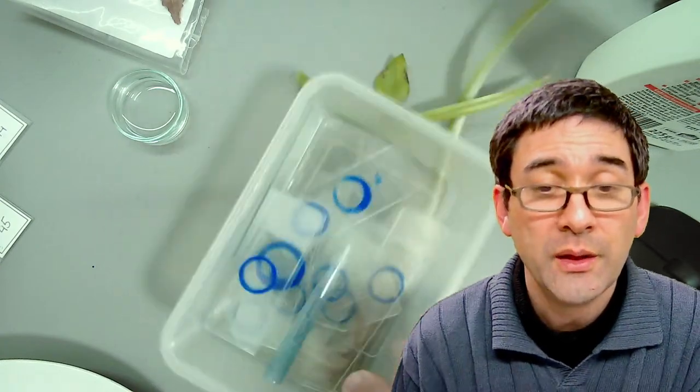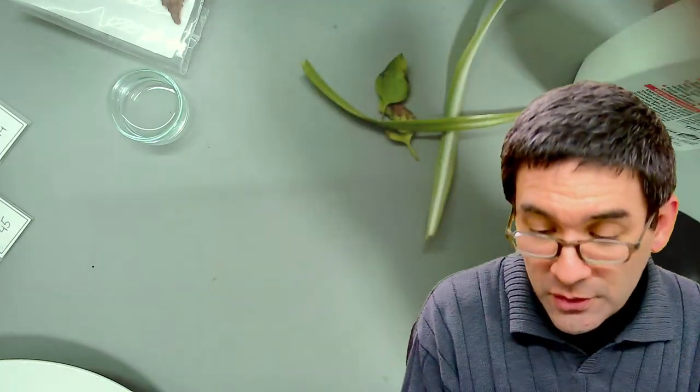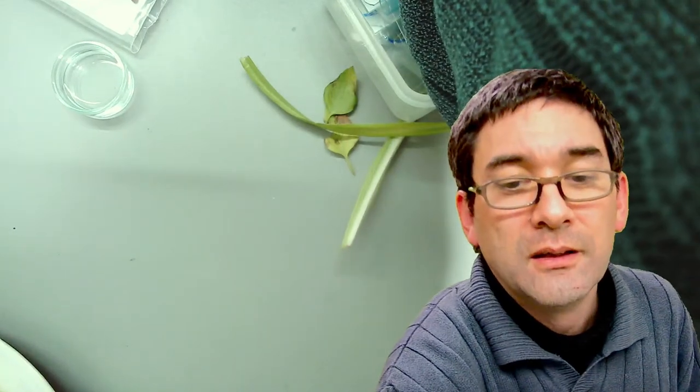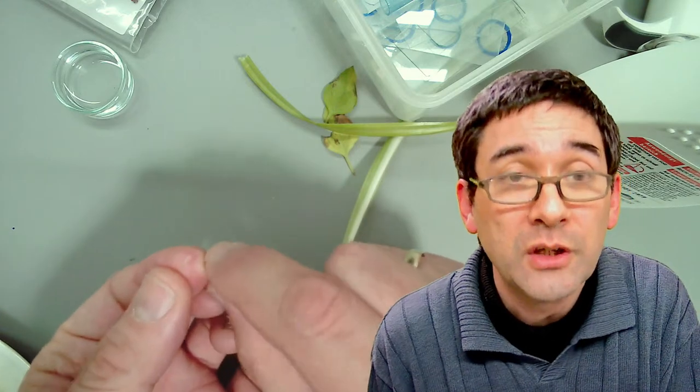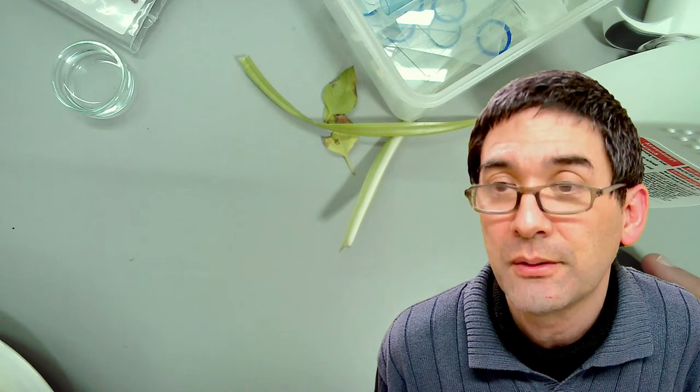So you don't want injuries, especially if there was some kind of dirty or decomposing material on the slides. What I usually do is I rinse it with hot water, and I put boiling hot water over the slides and cover glasses simply to kill off everything that might be dangerous there.